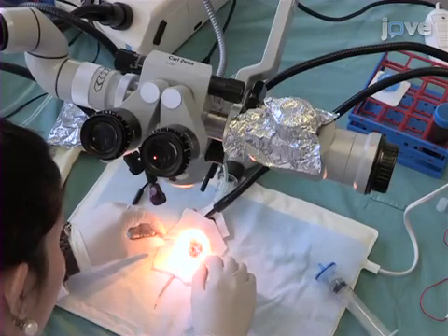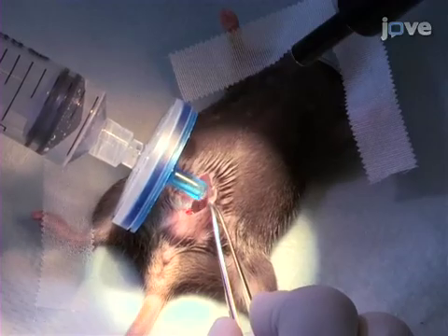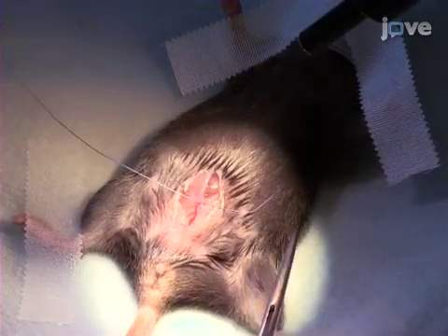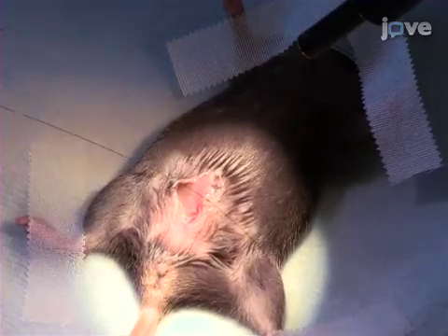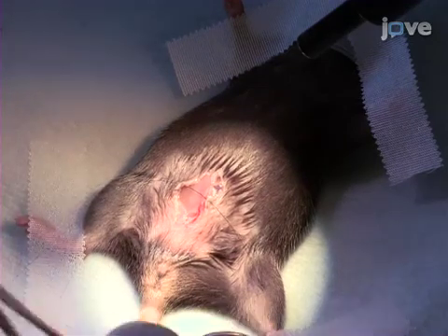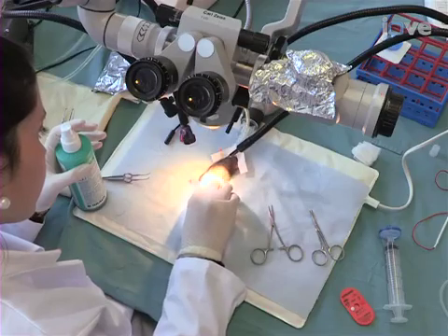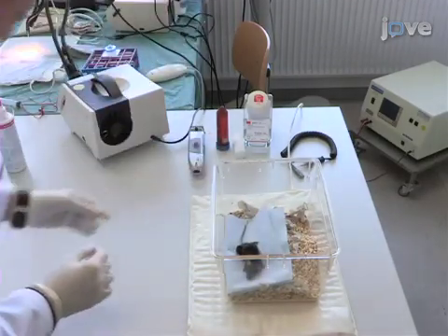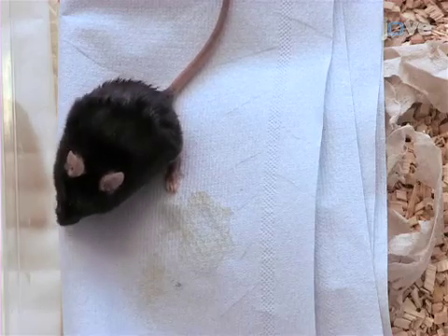After the injection and electroporation of all embryos, place the uterus back into the abdomen of the mouse very carefully and position them exactly as they were before. Then moisten the peritoneal cavity with saline before closing it. Suture the peritoneum with surgical catgut, then suture the skin with a more resistant suture. Disinfect the abdomen surface with iodine solution and inject a non-steroidal anti-inflammatory subcutaneously for pain relief. Remove the mother from the anesthetic machine, place it in a heated cage, and monitor it until completely recovered, checking daily for signs of infection or pain.